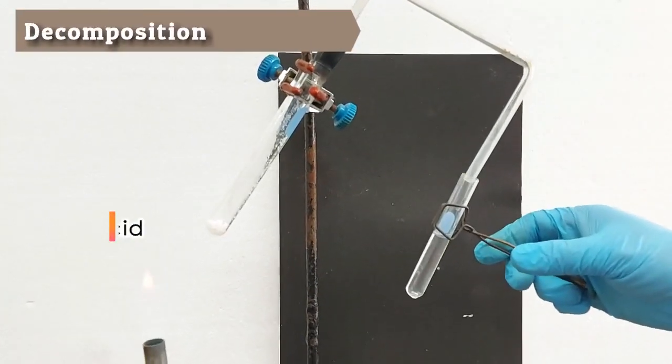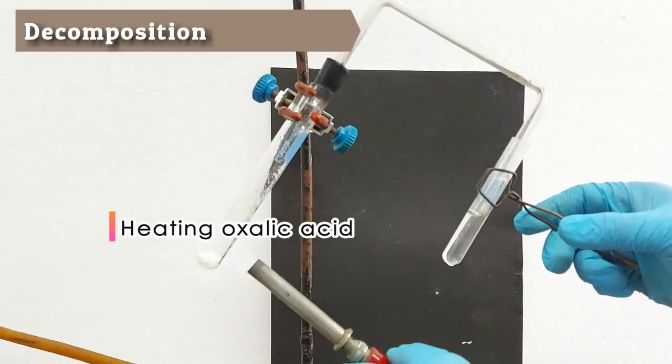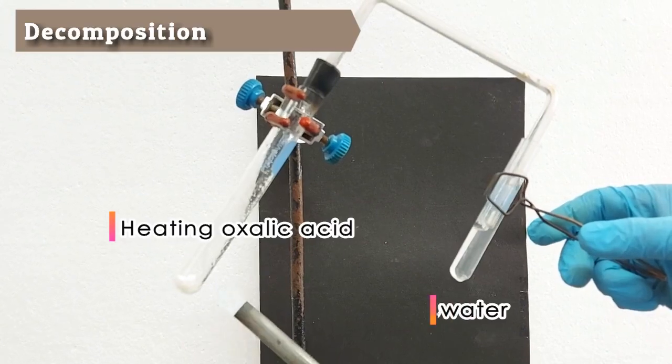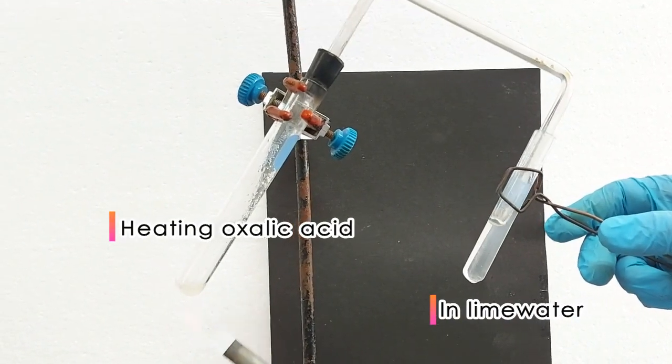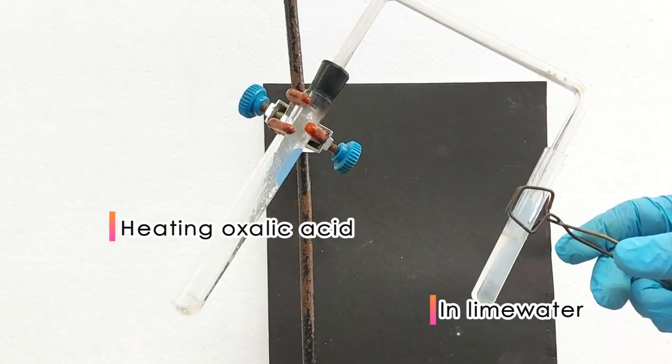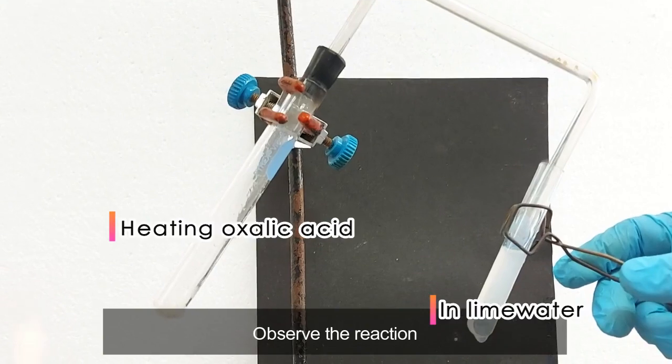Decomposition. Heat about 0.5 grams of oxalic acid crystals in a test tube attached to a delivery tube leading to a receiver containing lime water. Note the evolution of gas. Observe the reaction.